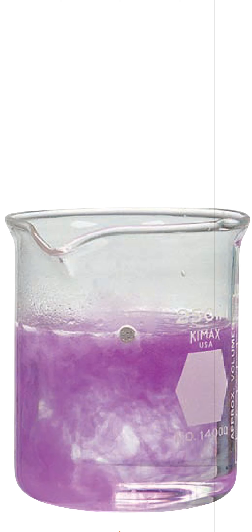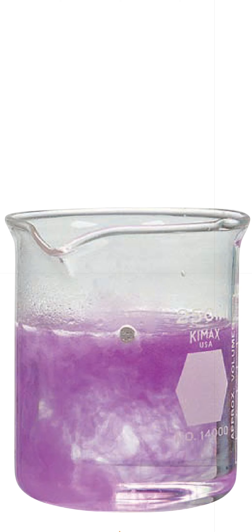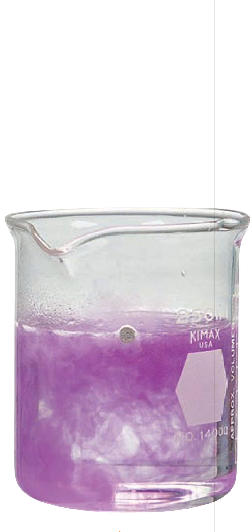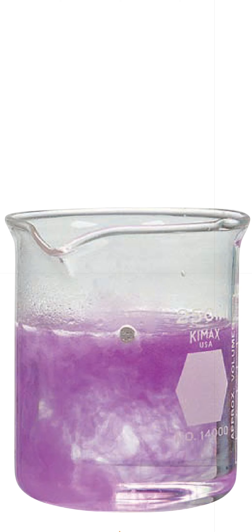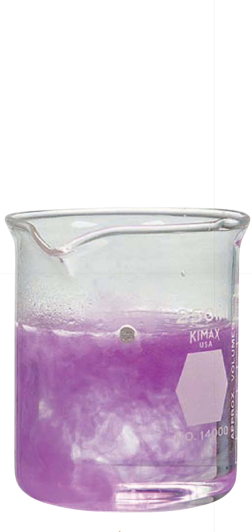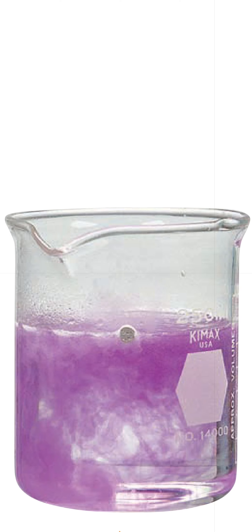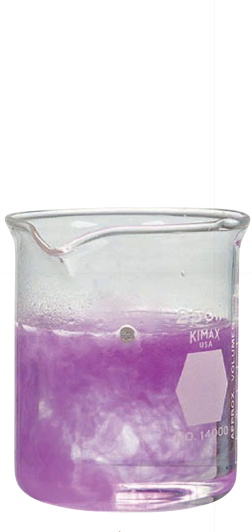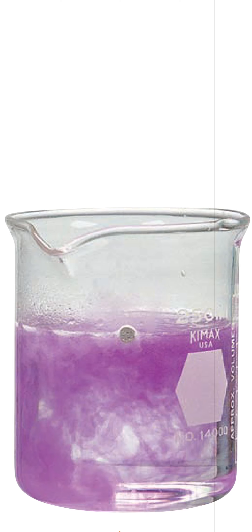This reaction is sodium and water. Sodium very vigorously reacts with water — it produces fire. But this reaction also produces sodium hydroxide. If you add phenolphthalein, its color in neutral medium is colorless. So this is the reaction between sodium and water.